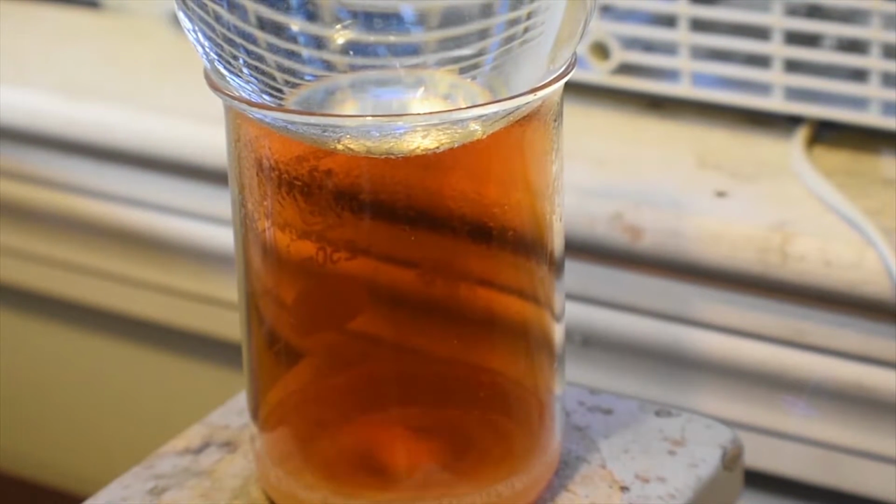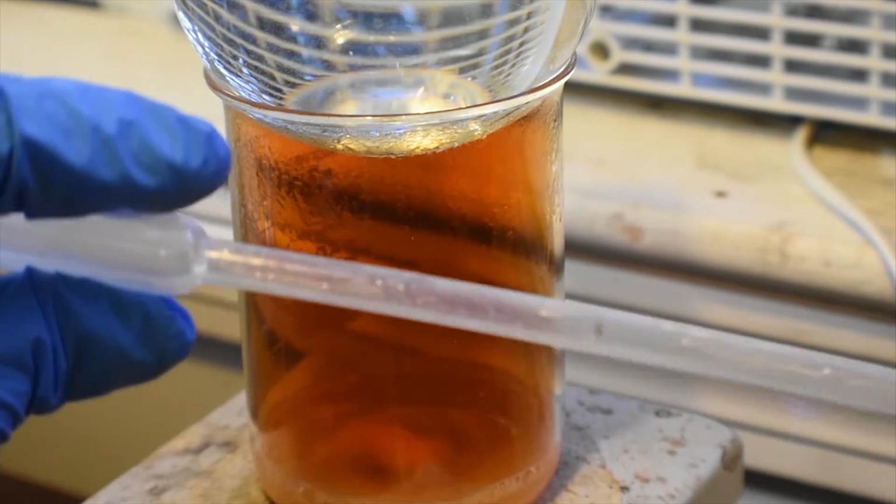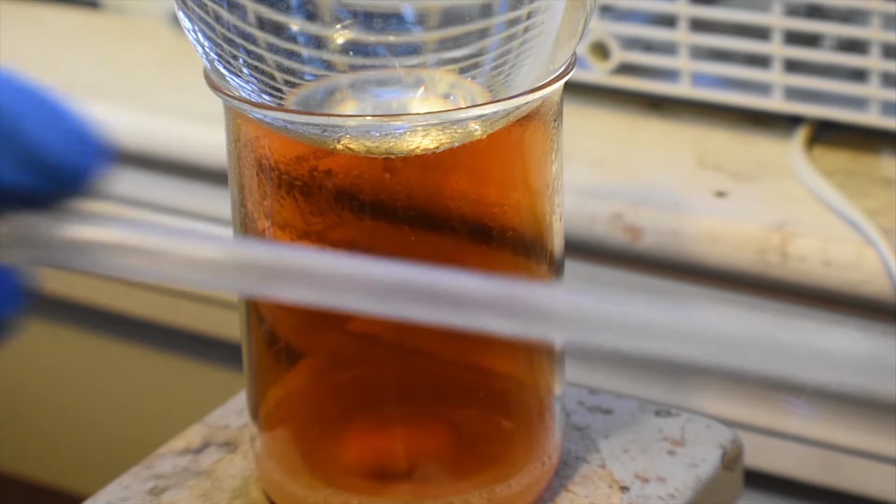If you heat up the mixture too much, you might boil off some of the nitric acid. That will lower your yield a fair amount. And it also will mean that you will have an impurity of inositol, or derivatives of the reaction. So basically what I just did is added a few milliliters more of nitric acid, about as much as I lost. So about 2 pipettes full. It's not a huge pipette, but probably about up to here.